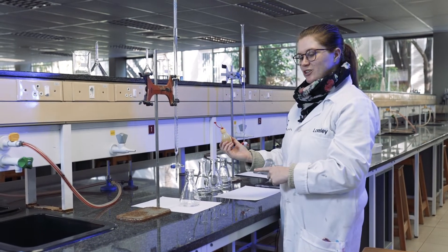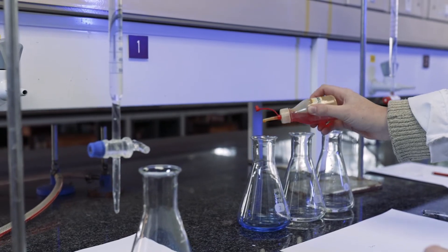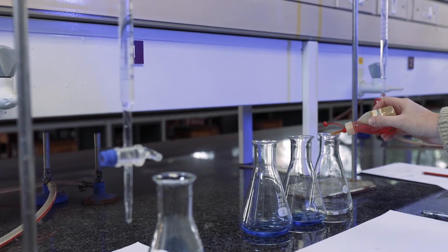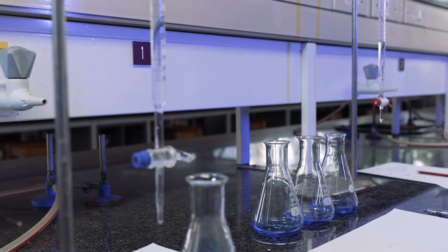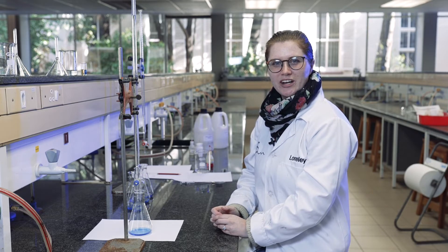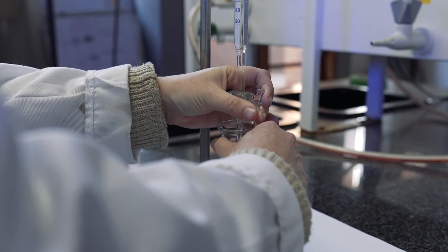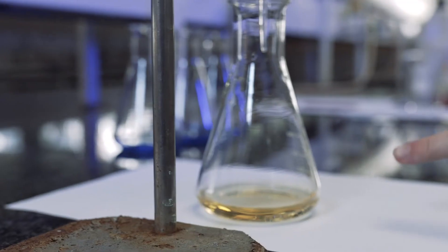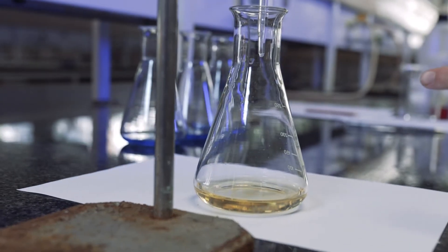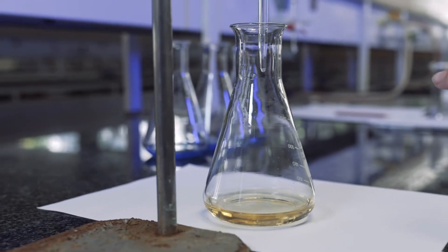Always remember to add indicator into your Erlenmeyer flask. Now we are going to start with our rough titration — we can do this by adding one millilitre of solution at a time and just swirling the flask in between; it does not need to be accurate. This one is over-titrated because it's yellow and we are looking for a green color, but that's all right — we can still use this rough titration value to calculate how far we need to go for accurate titrations.